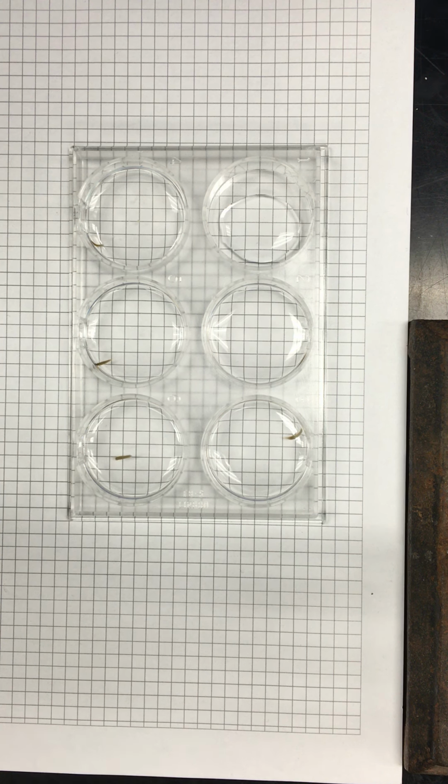So I'm going to make it up at 10 millimolar. You only need to add a very small amount. So it's 10 millimolar. Okay, there you go. You're all set. I'll try to figure this out to make sure we can still just add one of our concentrations. Well, if I make the antagonist really concentrated, you only need to add a very small amount to your final volume, so that makes it easier to deal with.